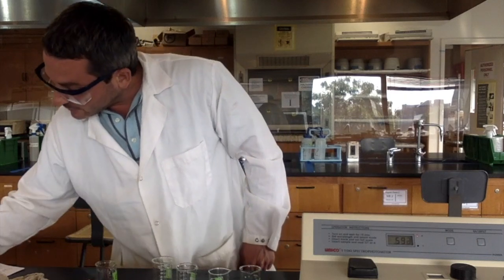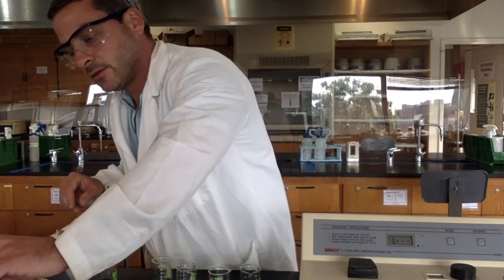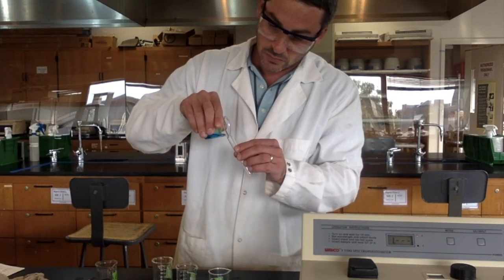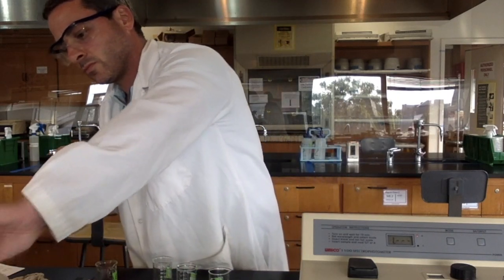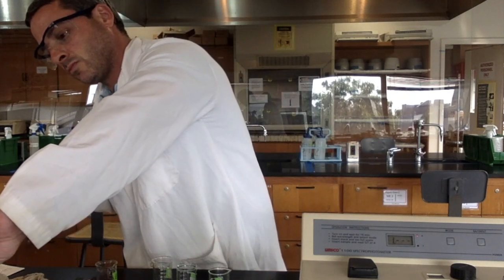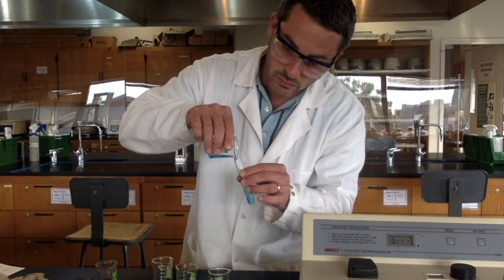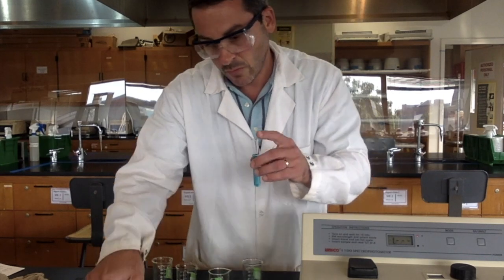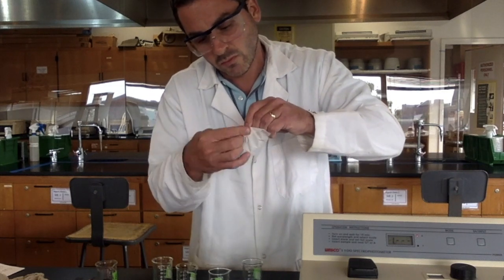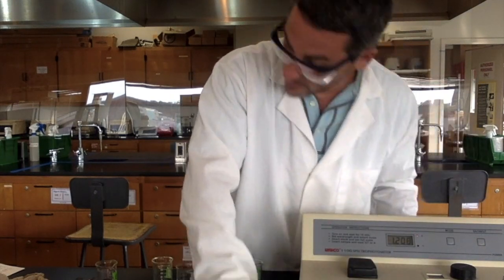B is 0.592, and then I get to A, which is almost my last one. Up nice. .208.